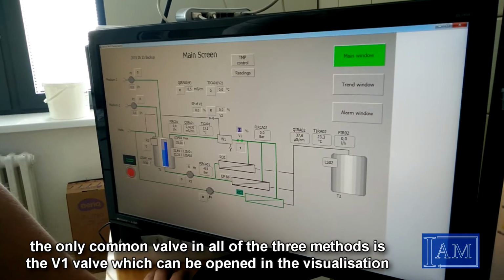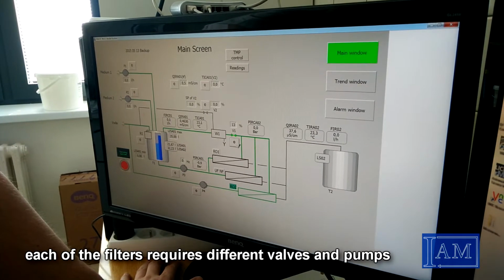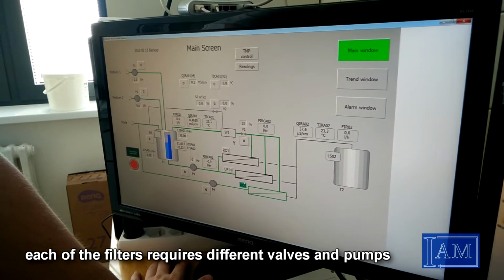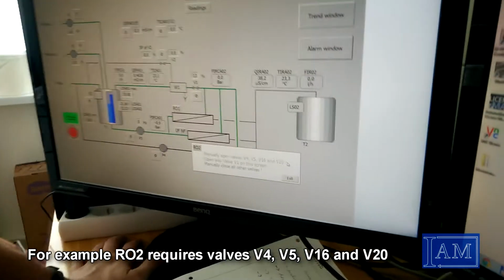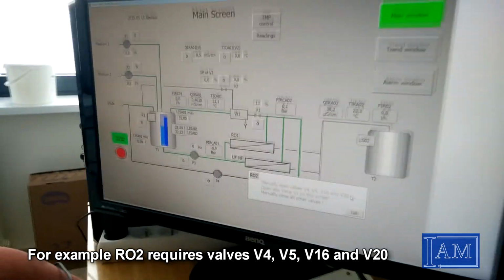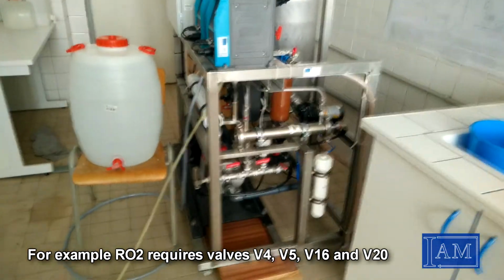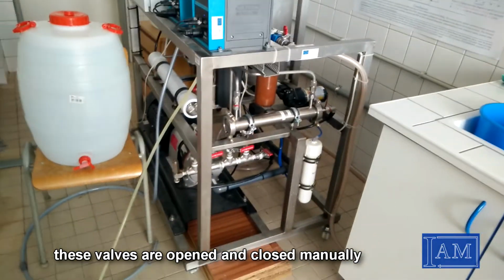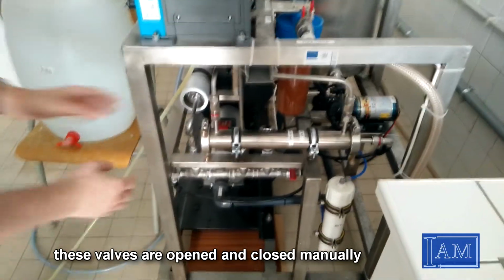The only common valve in all of the 3 methods is the V1 valve, which can be opened in the visualization. Each of the filters requires different valves and pumps to be opened. For example, reverse osmosis 2 requires valves V4, V5, V16 and V20. These valves are opened and closed manually.